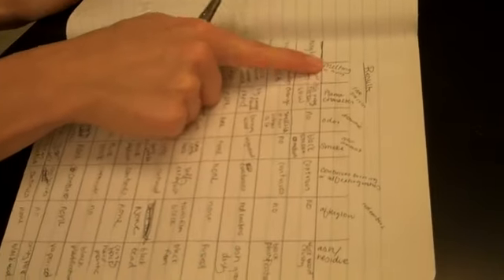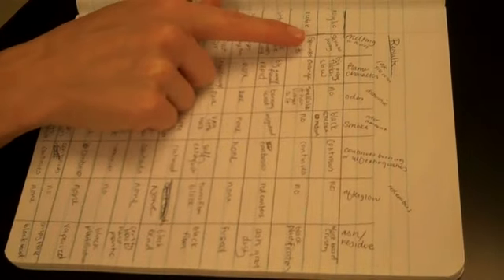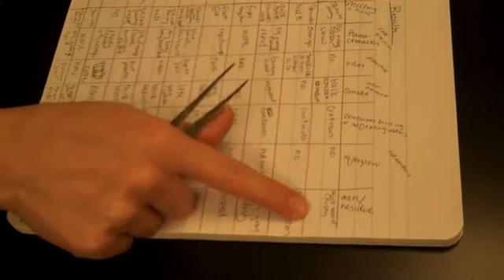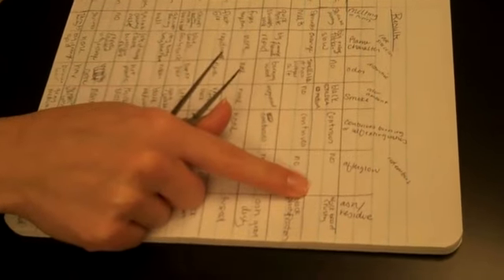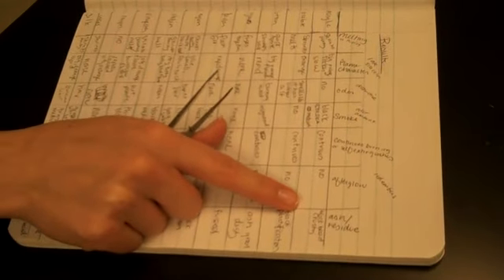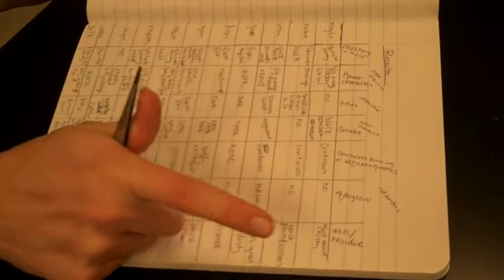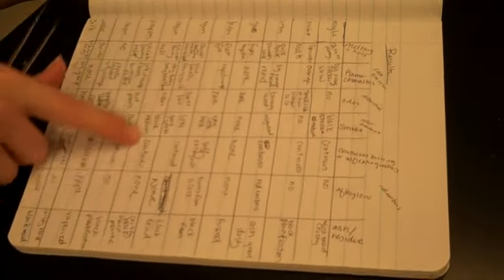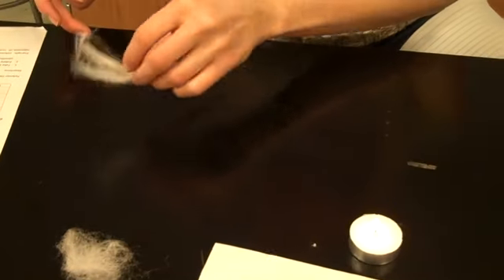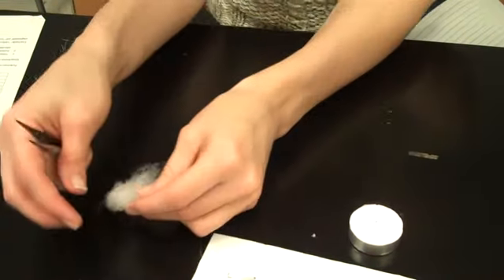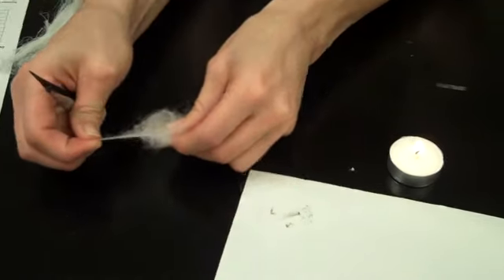So I would have all these properties of that particular fiber that I would write down in my notebook after I've tested it. I have all my fibers and all of those properties I just talked about. As I test each one, I would fill in the results I got when I'm testing known fibers, so that when I have an unknown fiber, I can match my characteristics to whichever one of these it is. That was a natural fiber—you can tell from the flame test results.